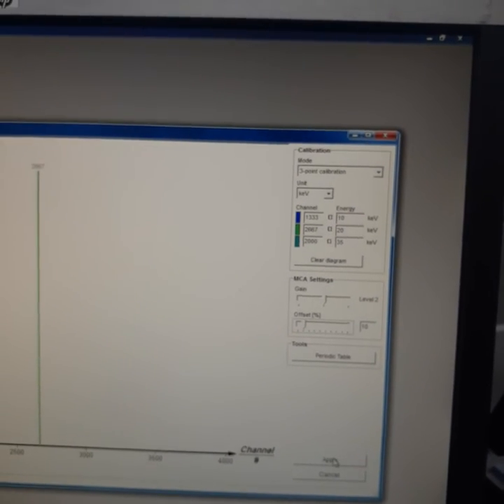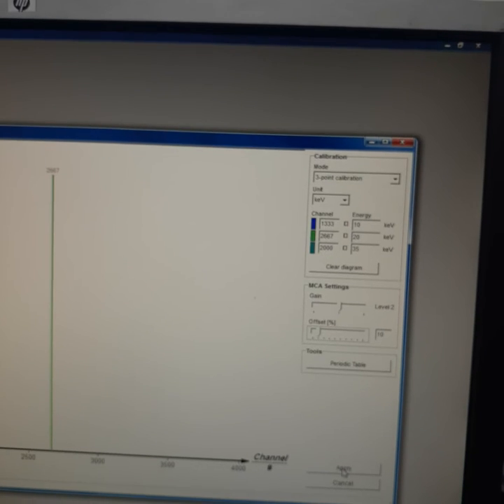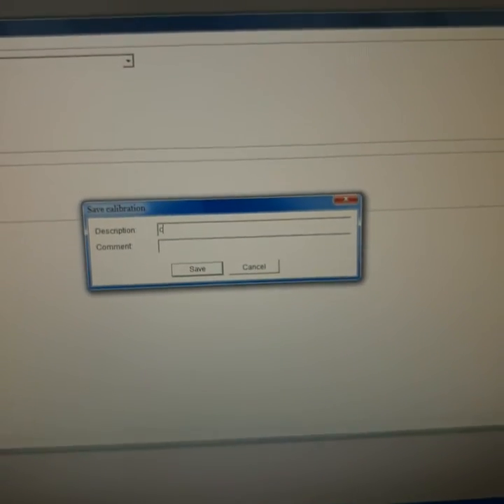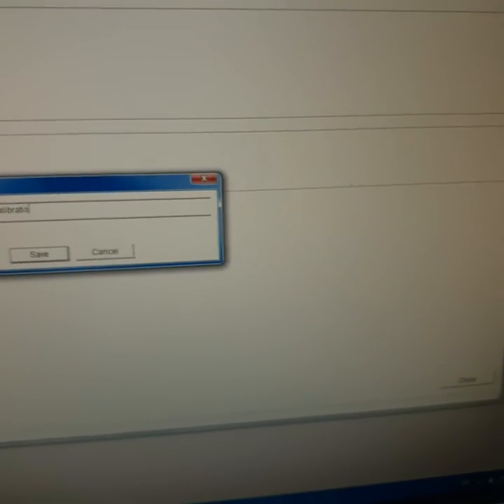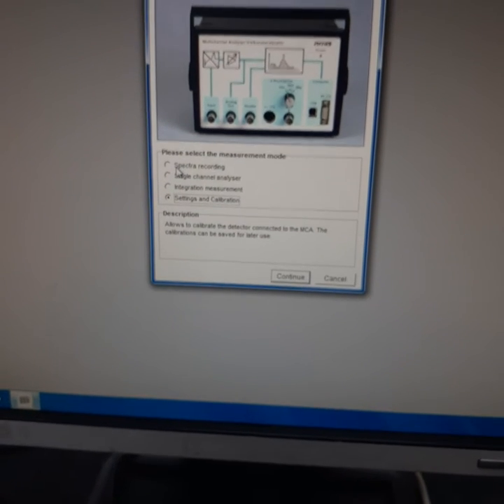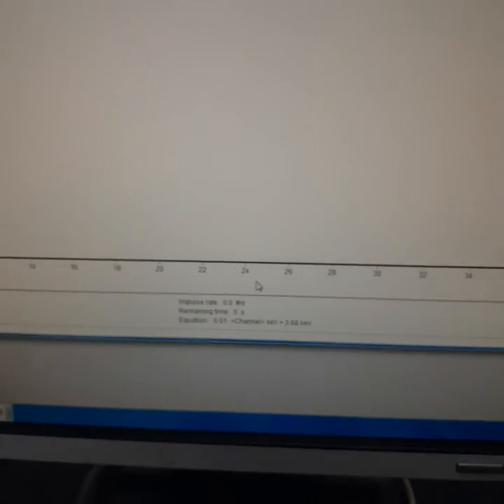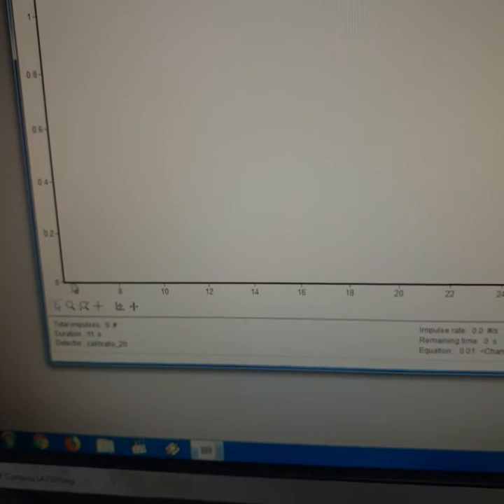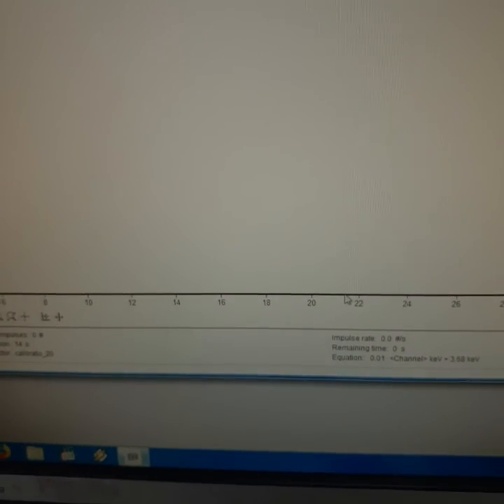So we will apply these parameters into our software. Then we have saved it into a new name. This name is calibration number 20, and there is no comment here. Save. Okay, and we will close this window. Then we will go to spectra recording, continue. I think we should observe some data here, but there is no data appearing from the multi-channel analyzer.